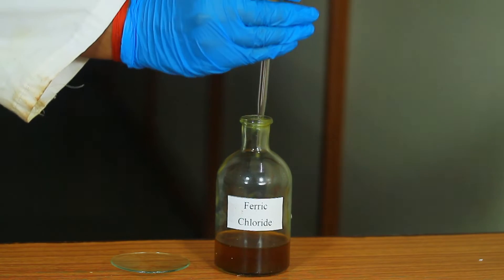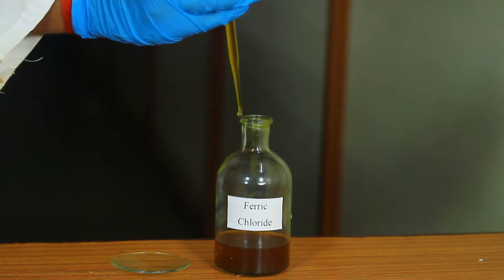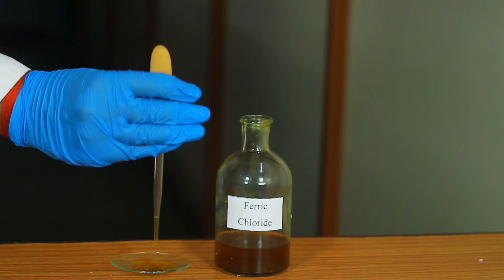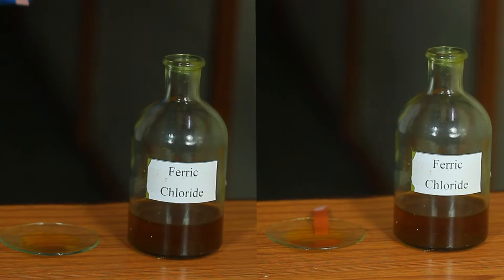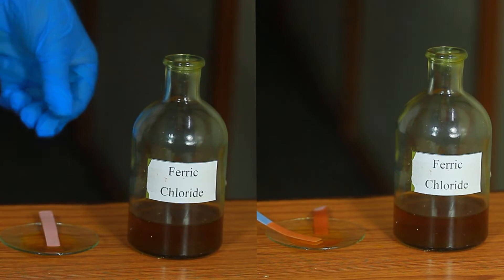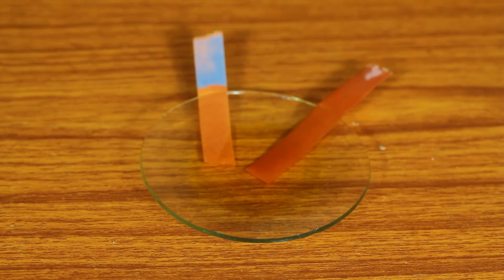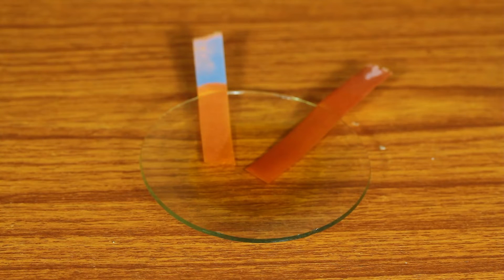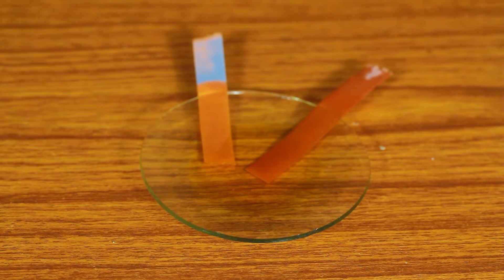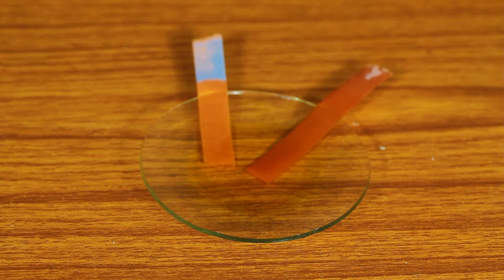Take about 1 ml of ferric chloride solution in a watch glass. Take a piece of blue and red litmus paper and dip it in the solution. Do you observe any change in the color of the litmus paper?